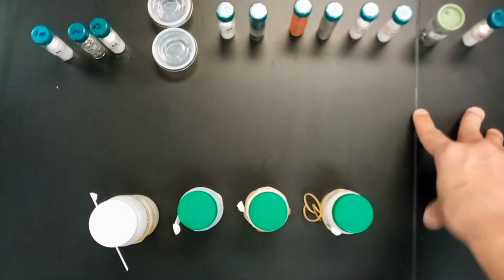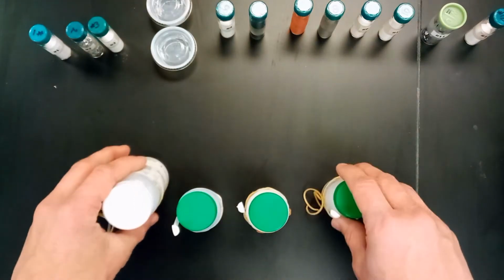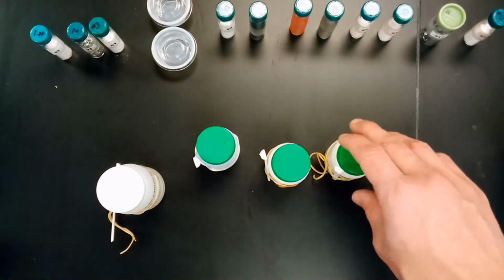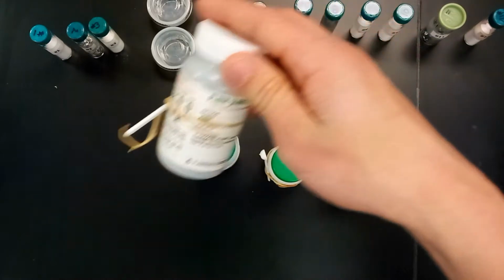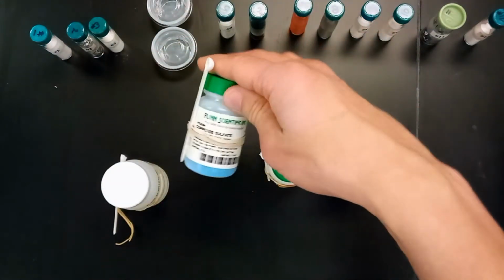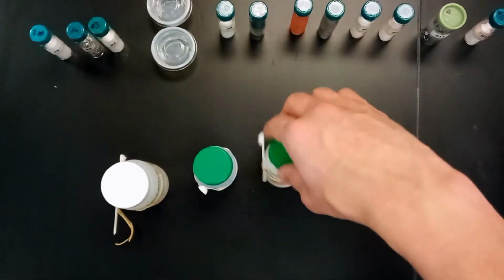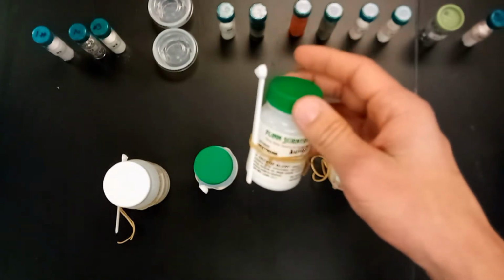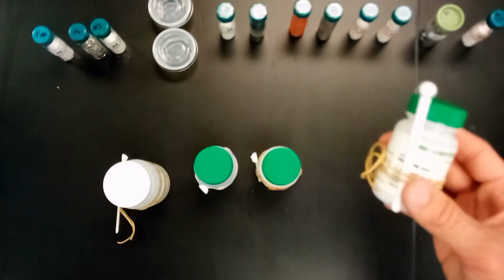Later on in this lab, we'll be taking each one of these and finding out some key attributes of each of them. But first, we have our 4 samples here that each represent a different type of bond. So you'll notice here we have some zinc, of course being a metallic bond. We have copper sulfate here, copper sulfate of course being ionic bonding. Dextrose, which is kind of a sugar, is actually a polar covalent bond. And paraffin wax is a non-polar covalent bond.